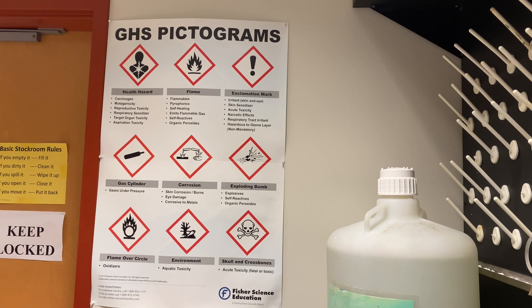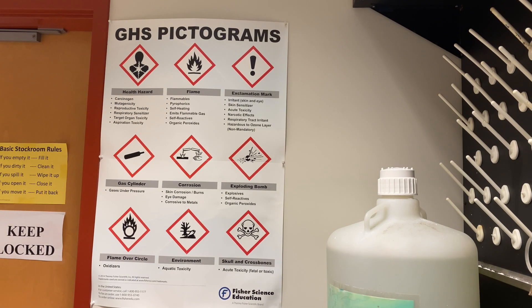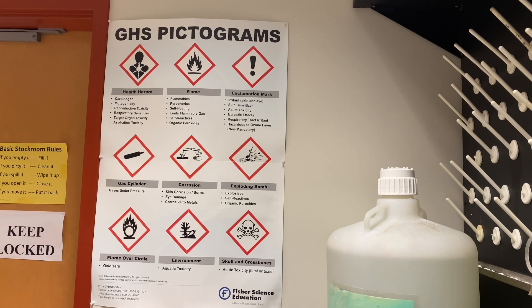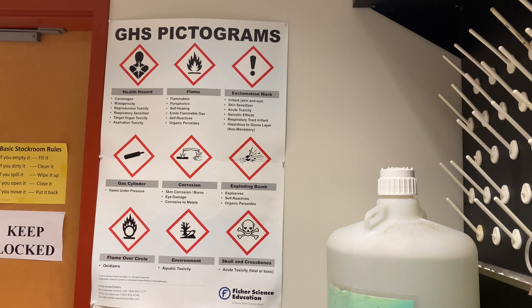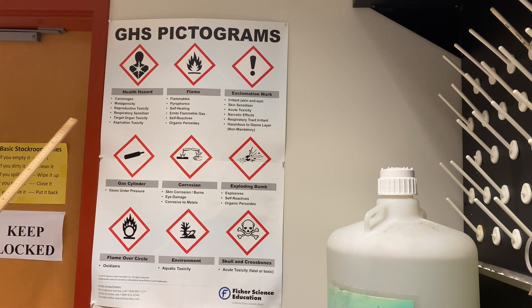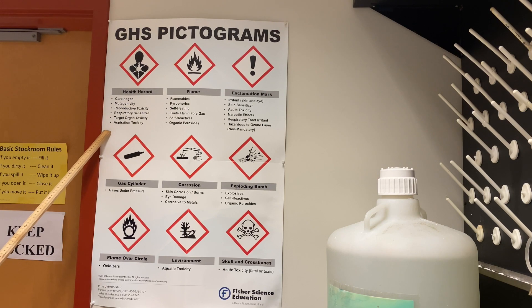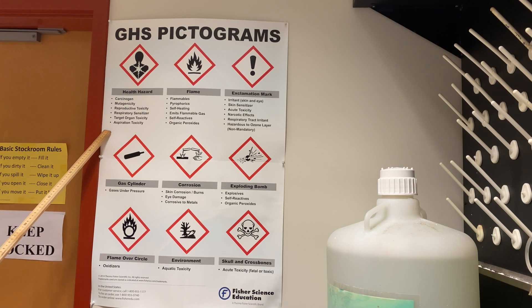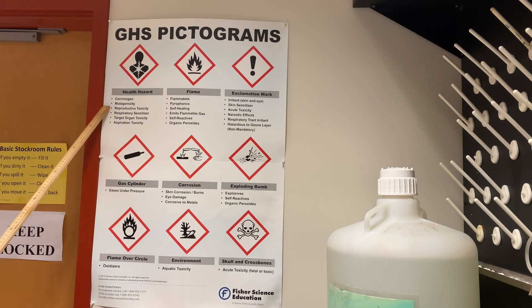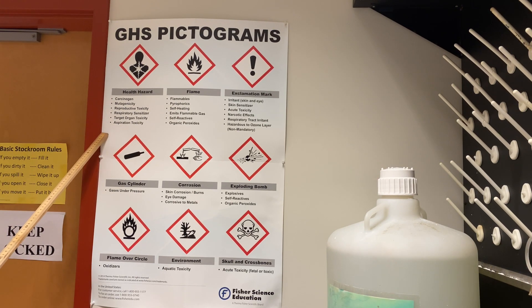Each hazard label has a description, as you can see. In regards to the pictogram, these are the things that you should be looking for hazard-wise.